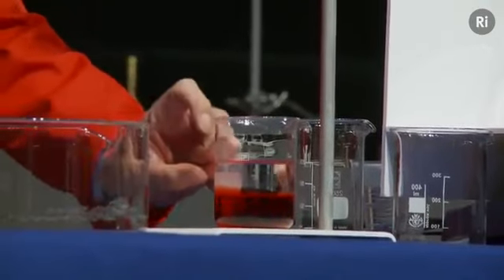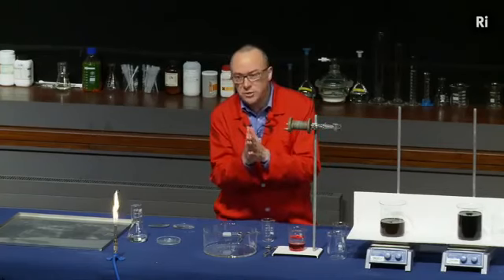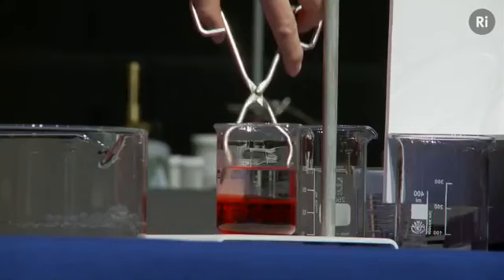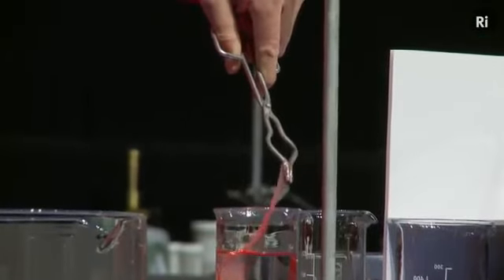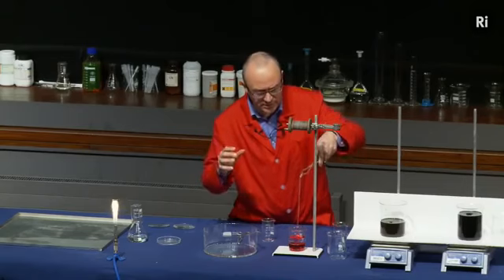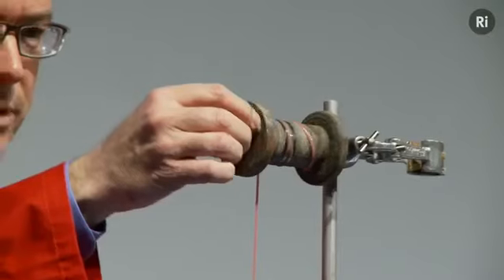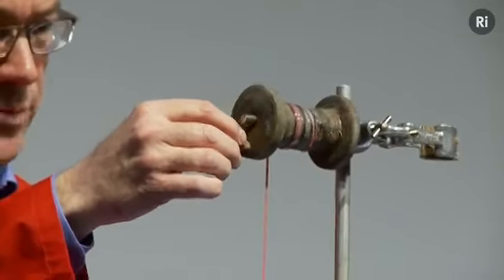So what I've got now is one liquid floating on top of another, and where they meet, they undergo a chemical reaction. They're actually making a solid. A solid material is formed where the two liquids meet. And what I can do is fetch out some of this solid material. As I pull it out of the beaker, of course, it allows the two liquids to meet each other again, and so they react again to form more of this solid. So as I wind, I'm pulling up this material, and it allows the two liquids to meet again, and it forms more of this material.